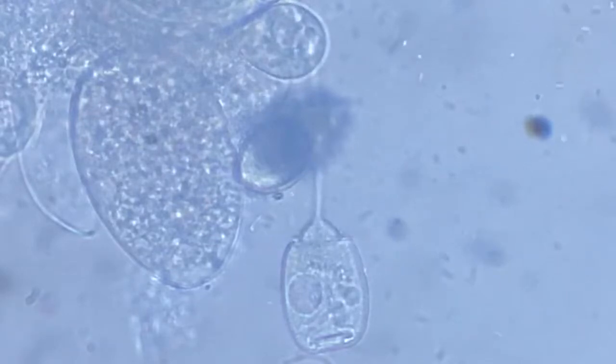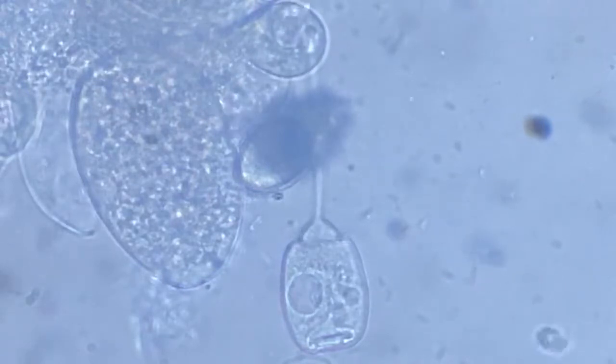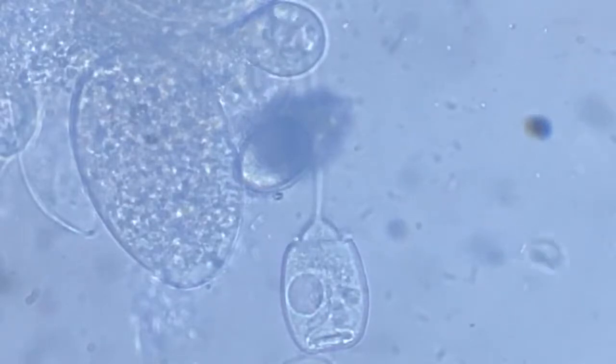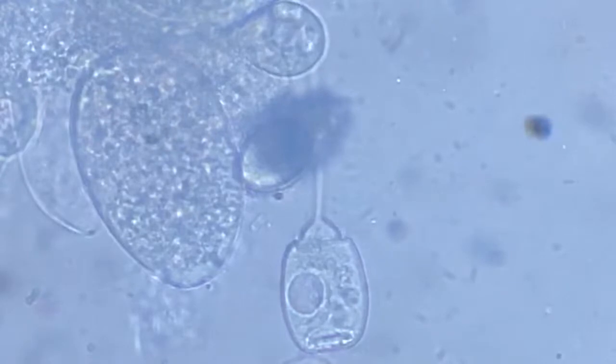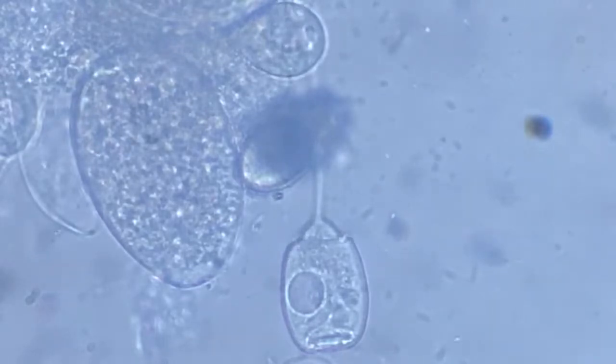Maybe he'll be vacating the vacuole now, emptying it. It's becoming bigger and bigger and bigger. It's really big now. Will it just flush it out? Let's see. He has reached almost the periphery.